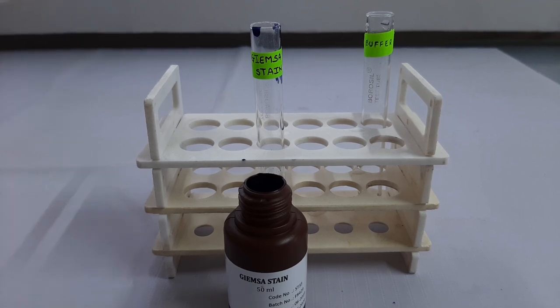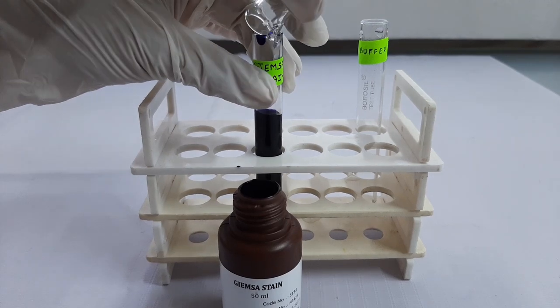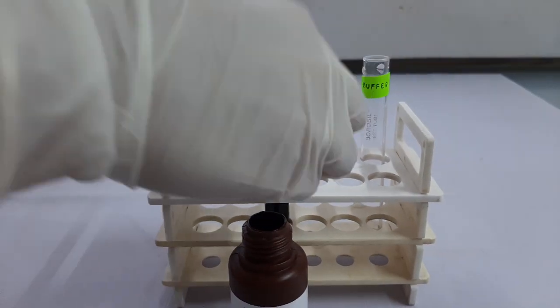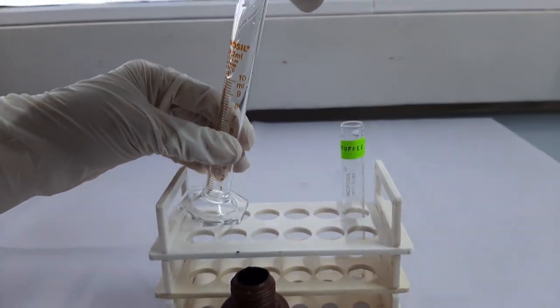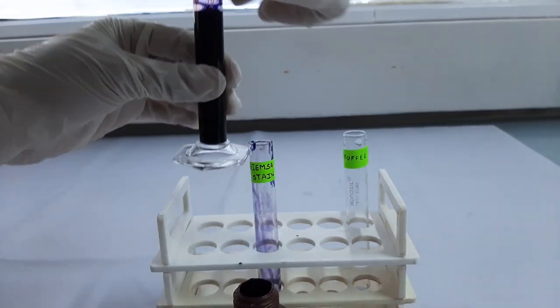In this tube, we will add 9 ml of the buffer which we previously prepared in step number 1 and then mix it thoroughly.